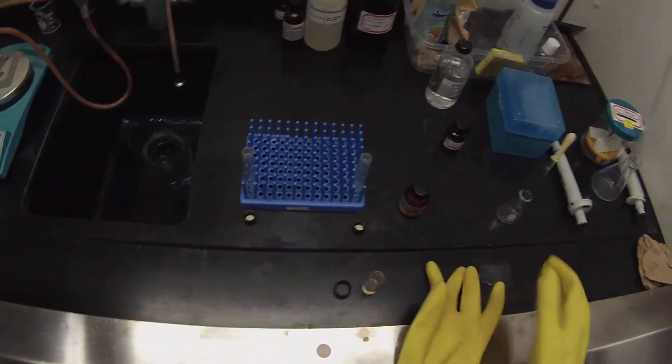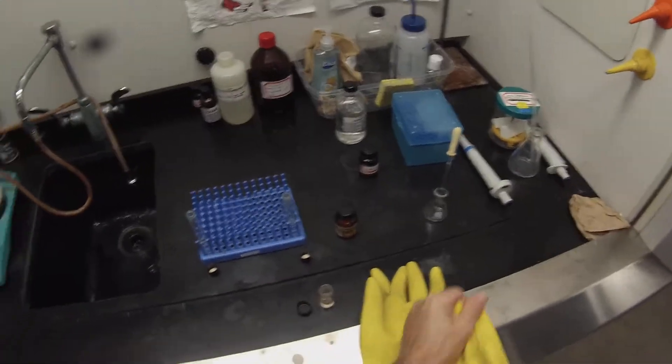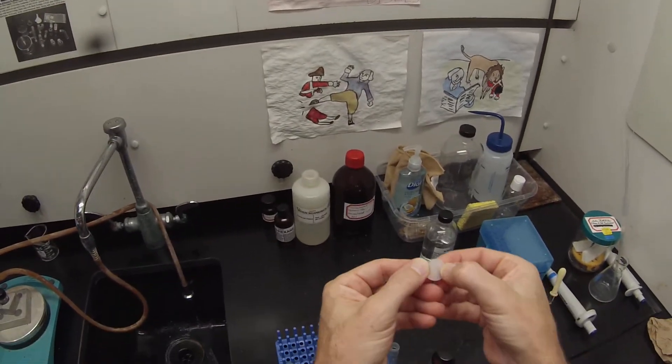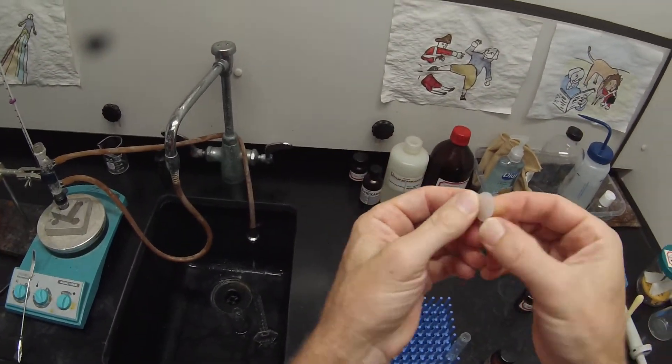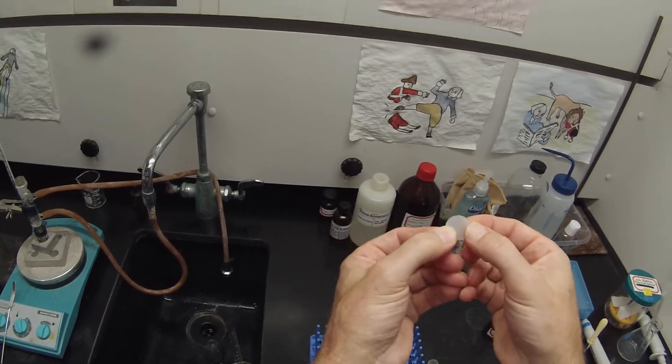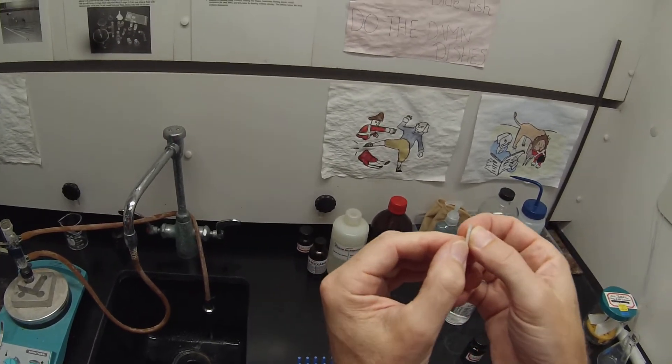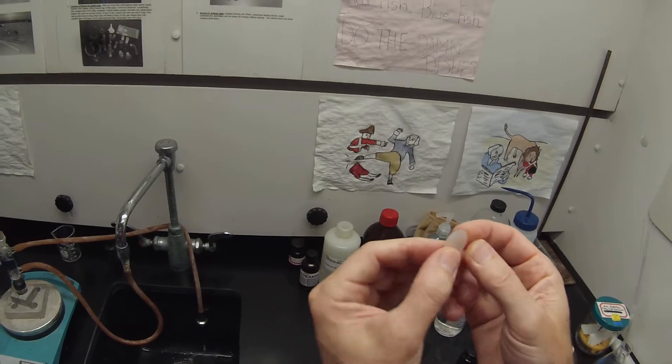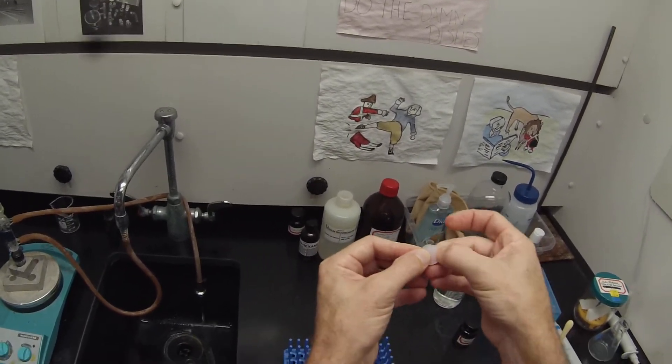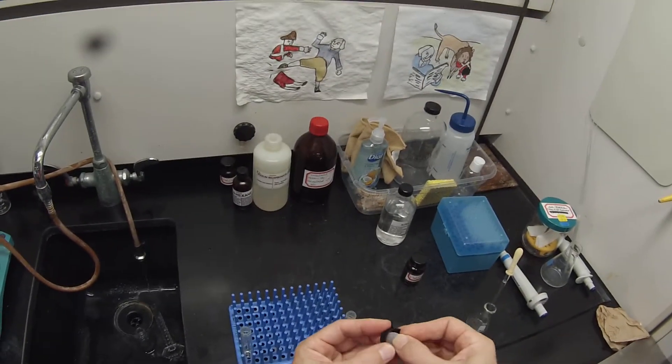It's hard to handle those with gloves on. So the septum cap has a Teflon side that creases when you stick your fingernail in it. So that's the Teflon. And then the silicone side that bounces back. And you can look on the side. Sometimes you can see the thin layer. This one's a little tough. The best way is to figure out which layer creases. And then that side's towards product, which means the silicone side goes up.